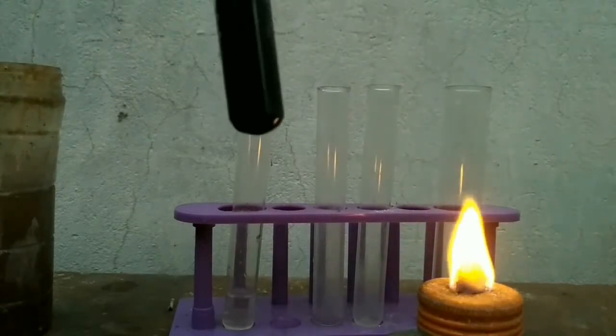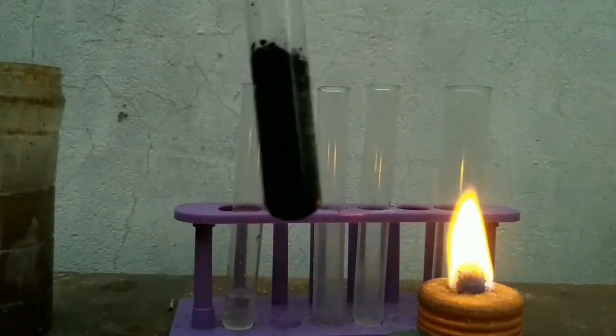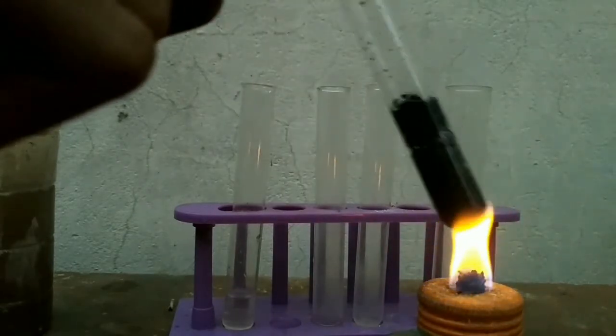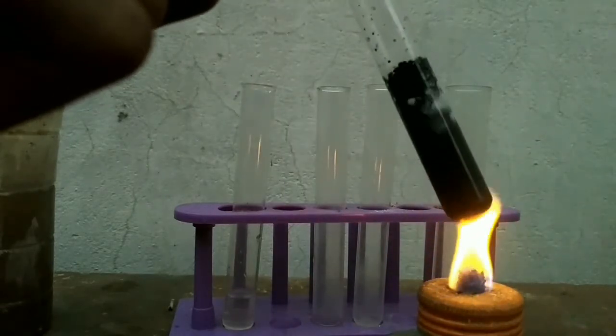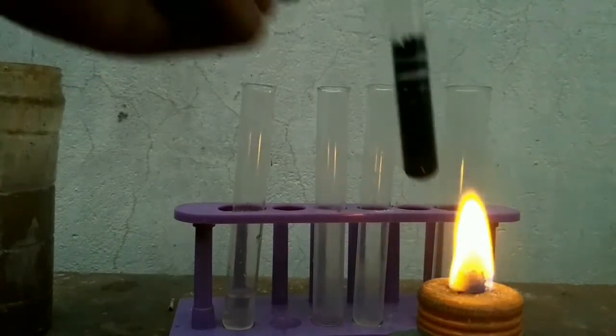You will notice a brisk effervescence. This is a confirmatory test for oxalate ions.